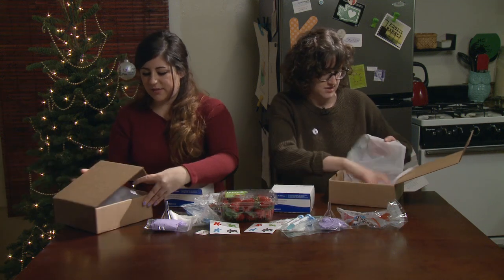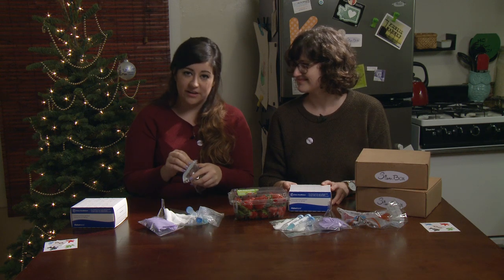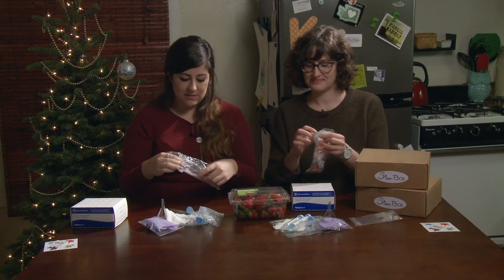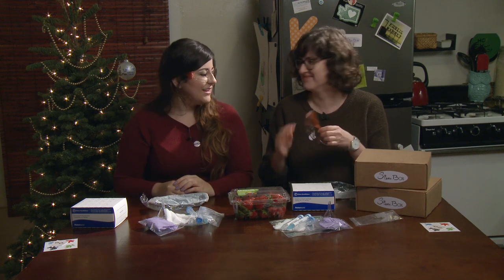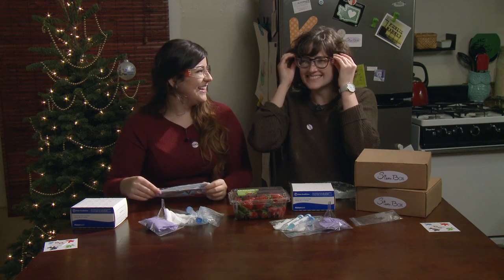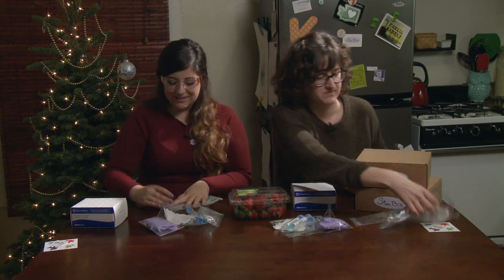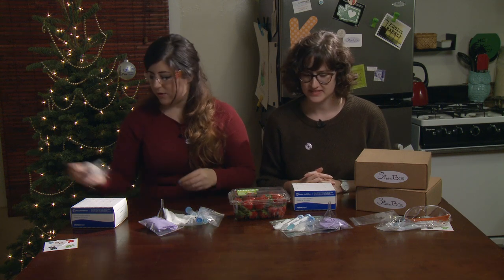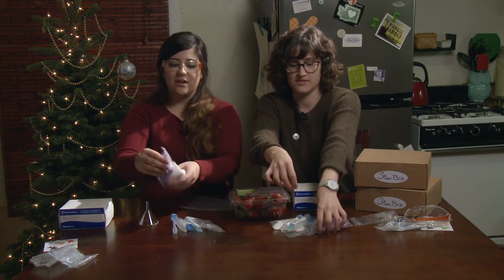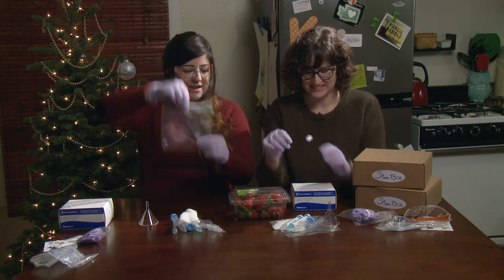We're going to close these up and get them out of the way. And of course, you're going to need some strawberries. Any good scientist will make sure that she and her surroundings are safe before beginning any experiment. So we're going to wear goggles if we can. We'll wear our gloves — glove five! Step one: mashing baggie. Now that we're safe.